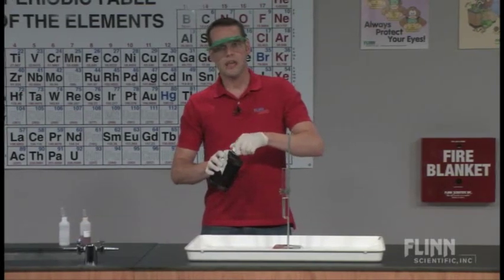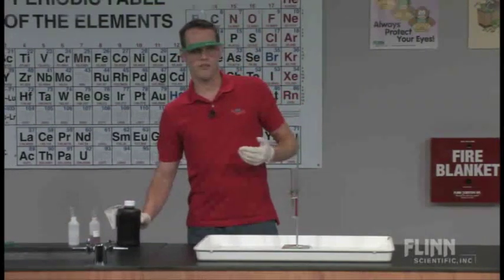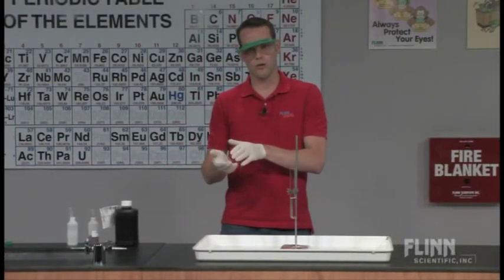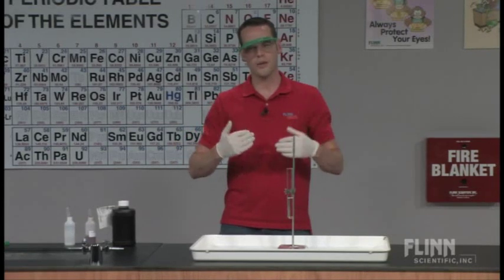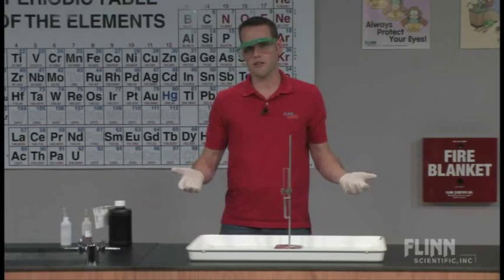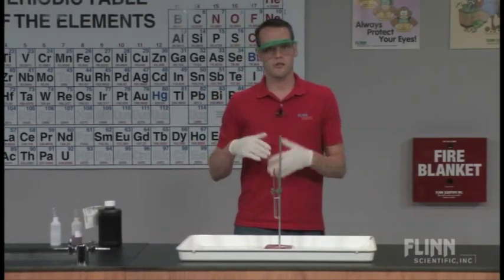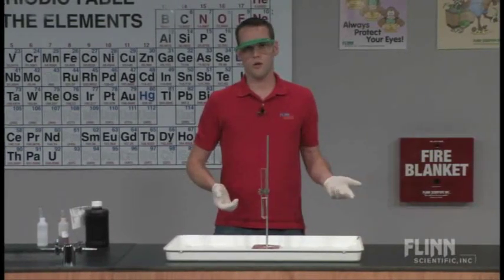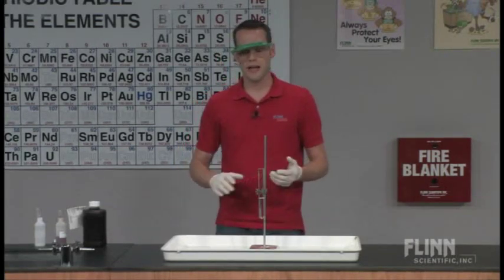You can purchase splash trays from Flinn. In my school, we have a photography lab and the photography teacher periodically has to get rid of the dishes they use for developing prints. She gave me her old splash trays — they're chemically inert substances. So talk to your photo teacher if you have one in your building and get them to give you the old trays whenever they get rid of them. It's another way to increase your supply of chemical splash trays.